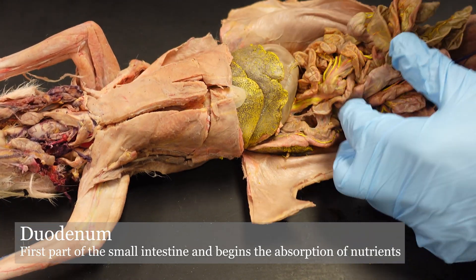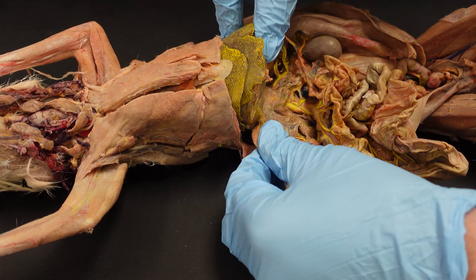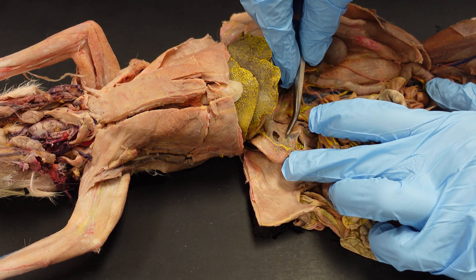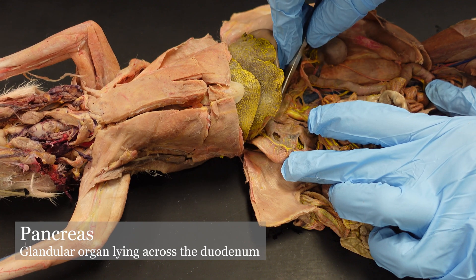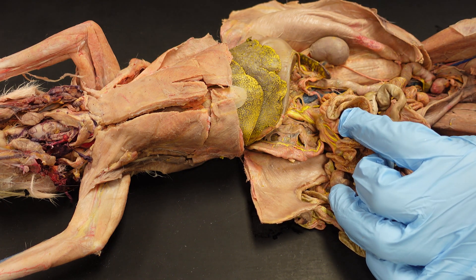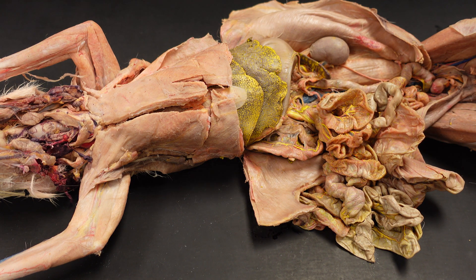The first part is called the duodenum. On the duodenum of your rabbit, you will find this material that looks rather like chewed-up gum — this glandular material is the pancreas. So on the duodenum you have the cranial pancreatic duodenal artery that extends to both the pancreas and the duodenum, because they're so tightly associated with one another.